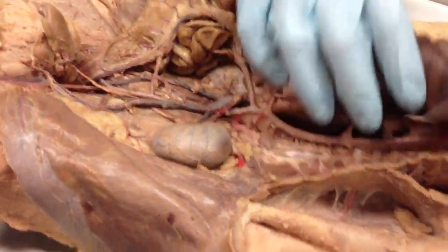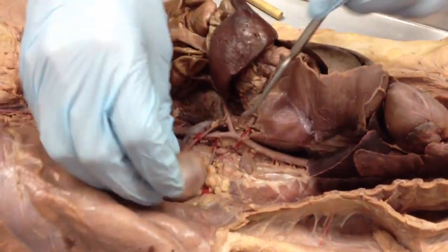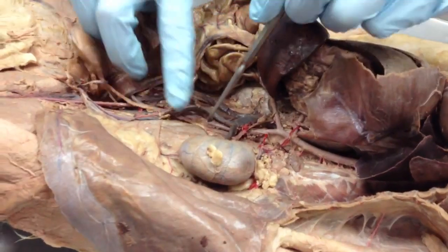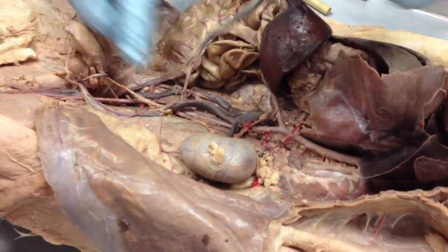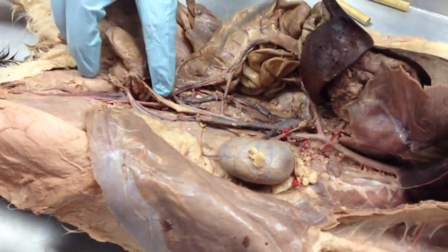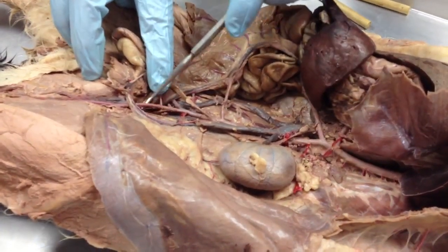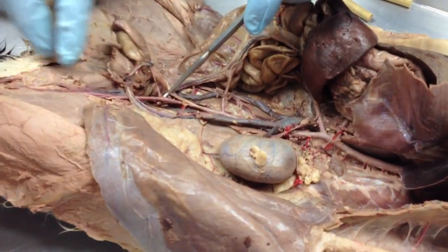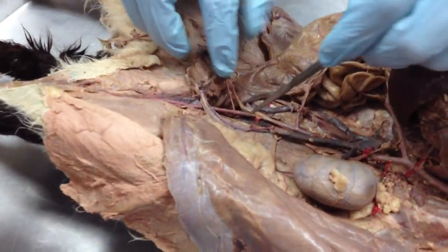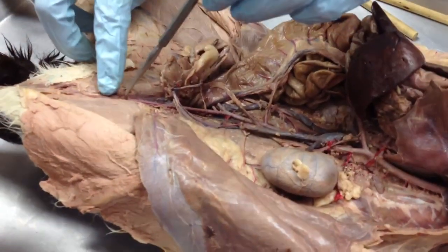Alright, so remember thoracic aorta here, go below the diaphragm, abdominal aorta here. And what I mean by that is this guy. See how it just continues on down? That red, large artery, abdominal aorta. Here it branches off into 2, going to each leg. The external iliac artery, that section right there, so pretty much immediately after it branches. And if you continue following it, that's the same guy there, that's your femoral artery. So if you see a pin in this area, right after it branches, external iliac artery. You see some down here, it's your femoral artery.